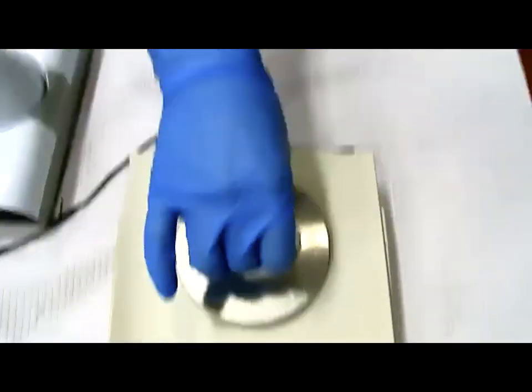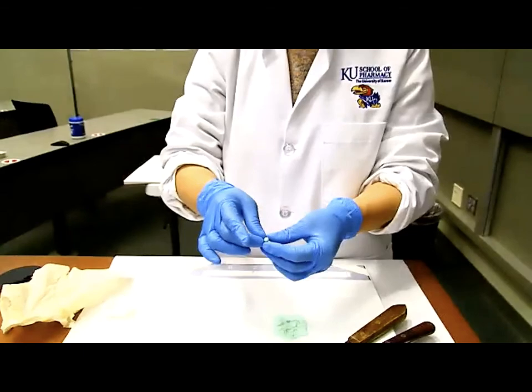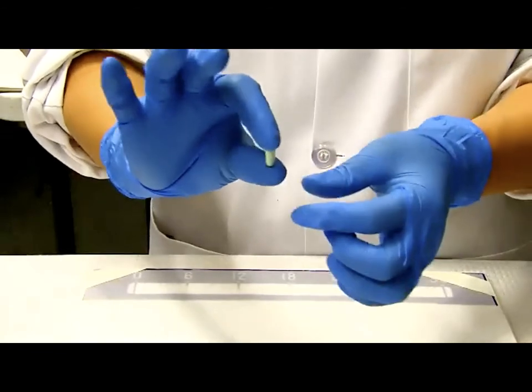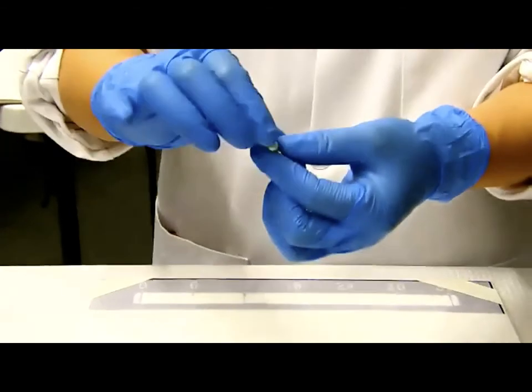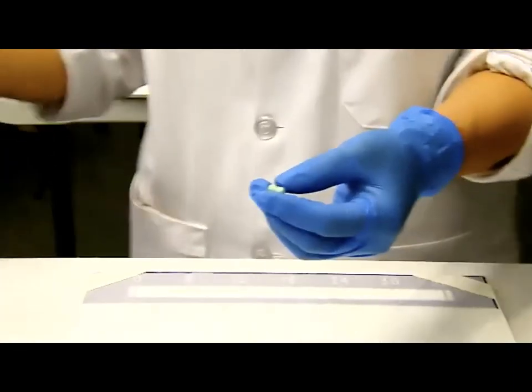The cap was not locked on yet, so you need to do the second piece. There are 3 pieces you have to do. The first one is the punch, we just said. Here comes the second one, which is pinch. You have to pinch down the capsule shell until you feel a little click. That means now it's locked. You are no longer able to pull it apart. That's the second P, pinch.